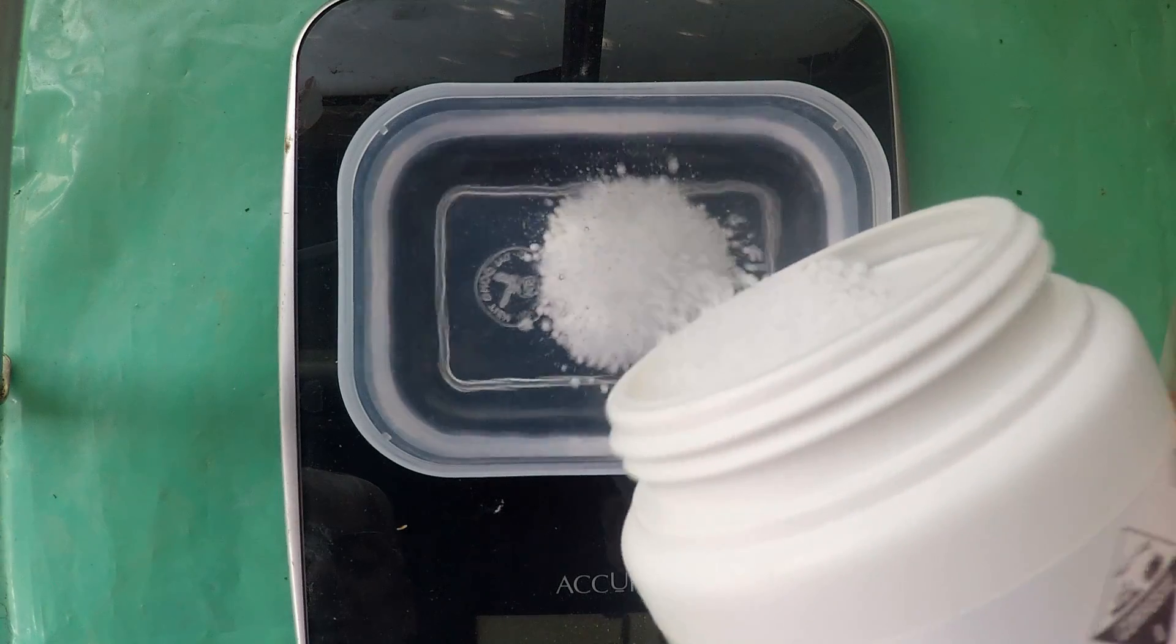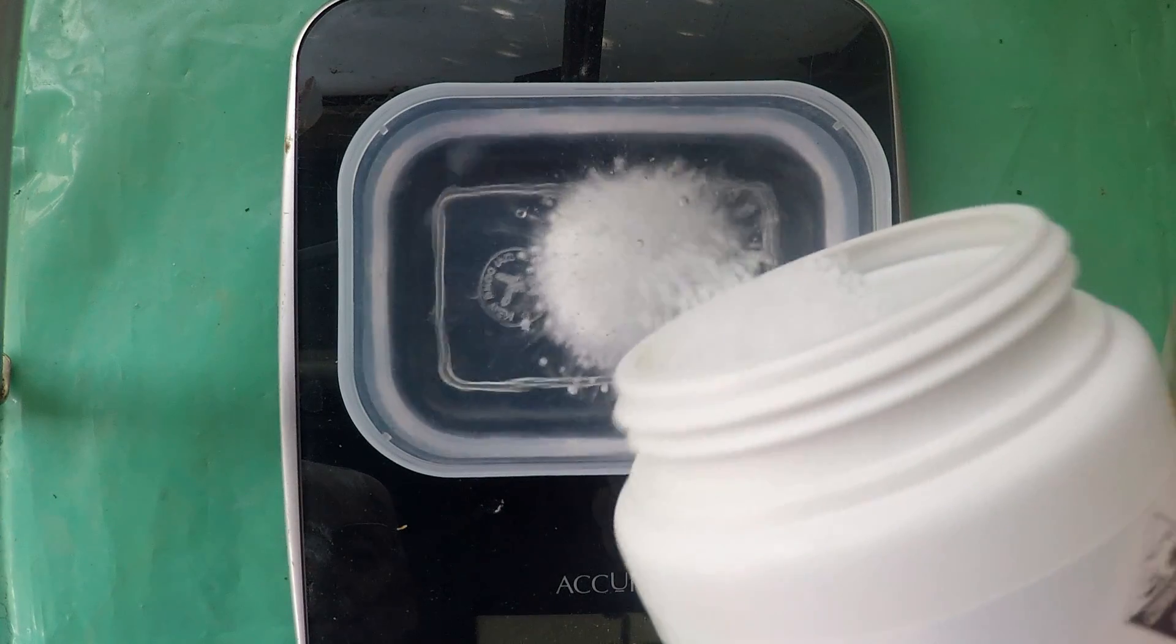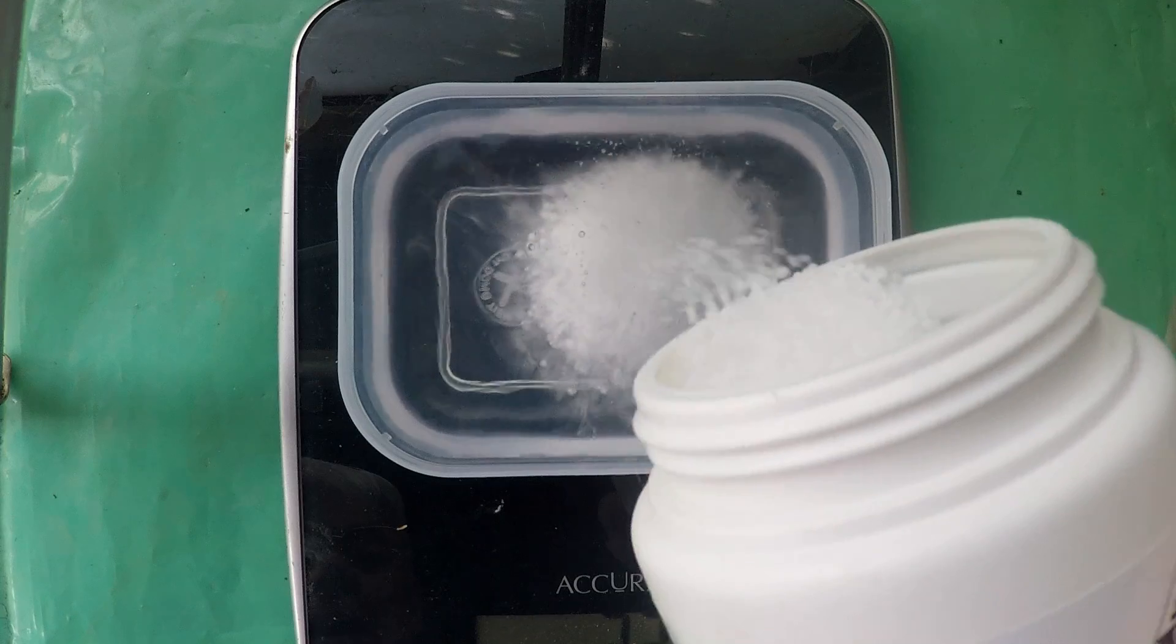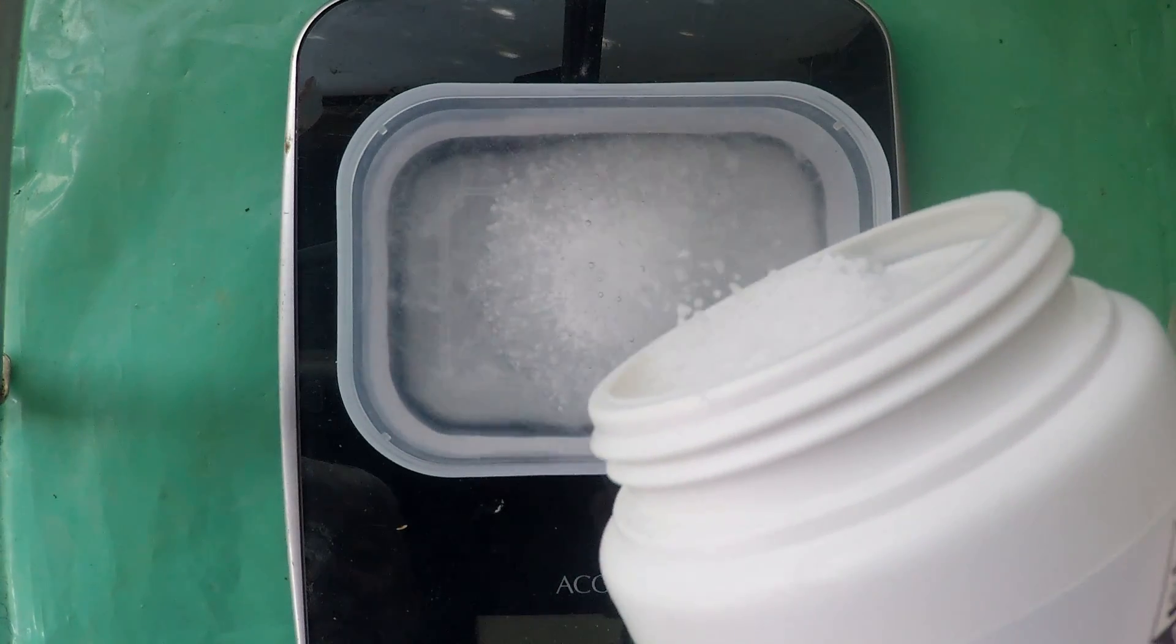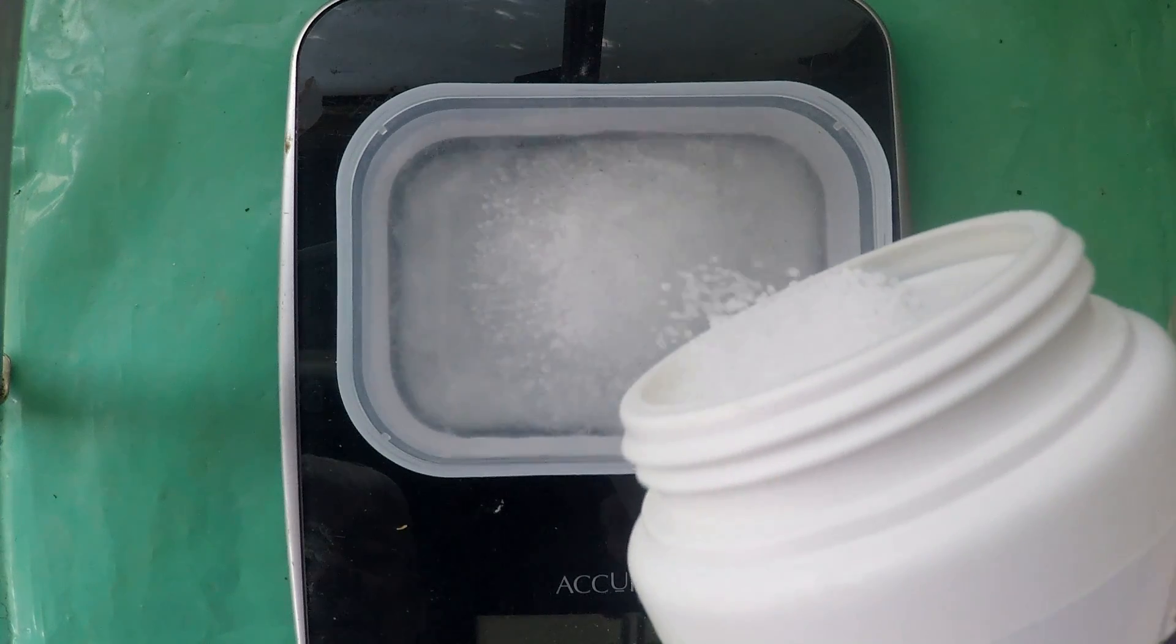Got to be careful adding caustic to water. It gets hot and in fact it can get so hot that the water will boil and spit bits of the caustic back out at you.